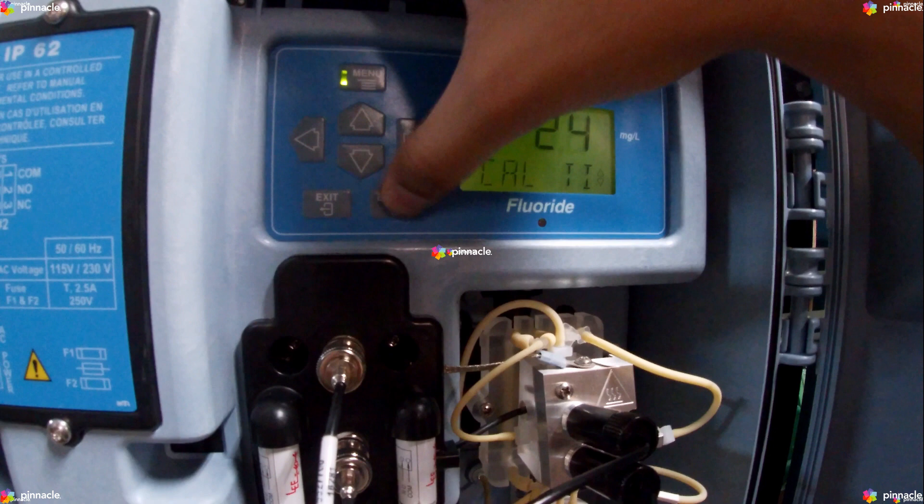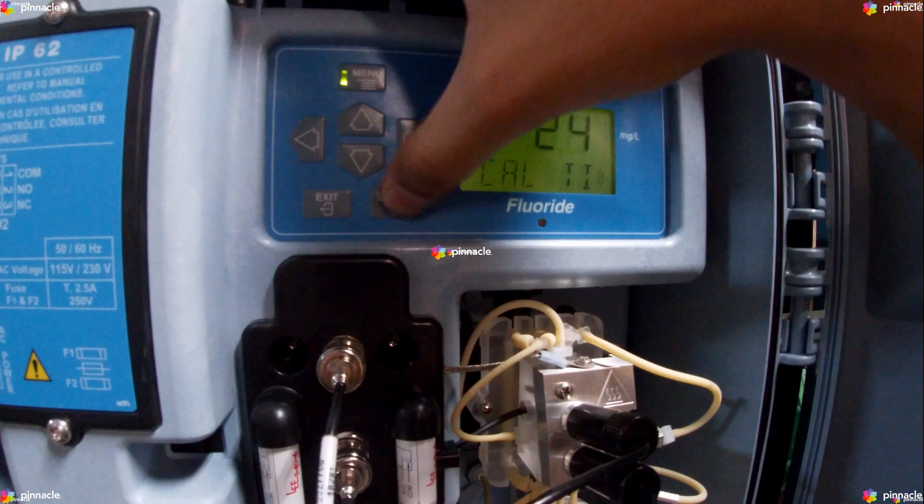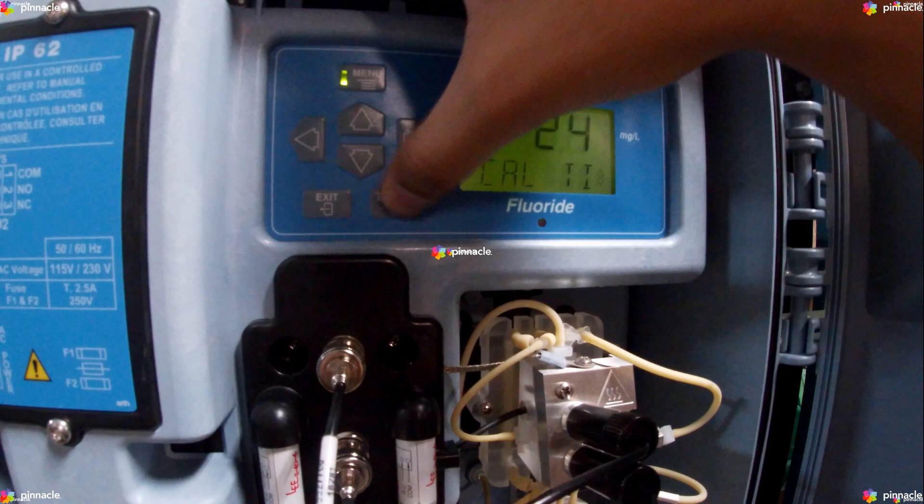In this menu, we have different options with respect to our calibration. They include our CalTime, our Calibration, our CalPart1, CalPart2, Offset, Slope, Standard1, Standard2, and Default Cal.